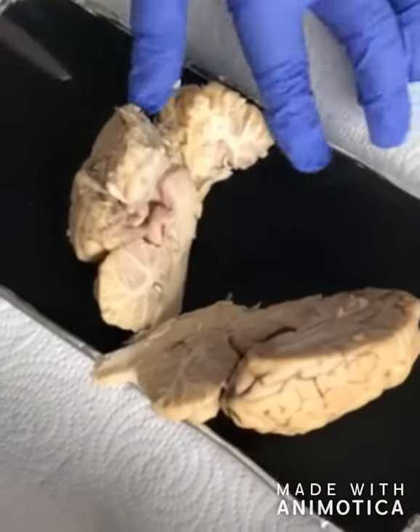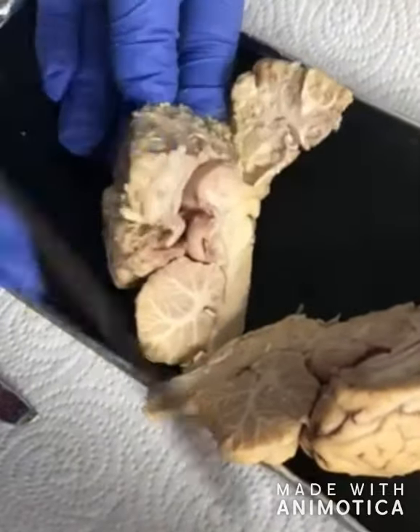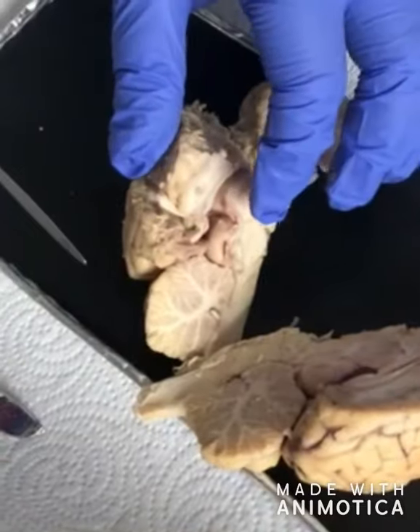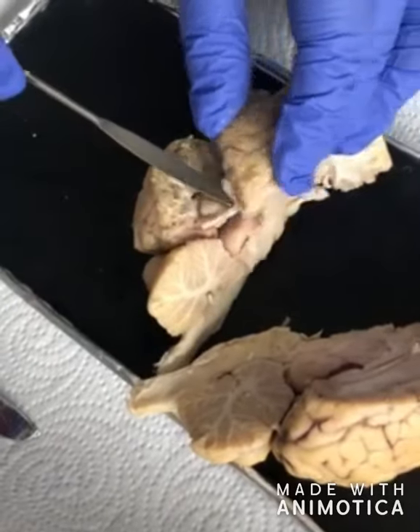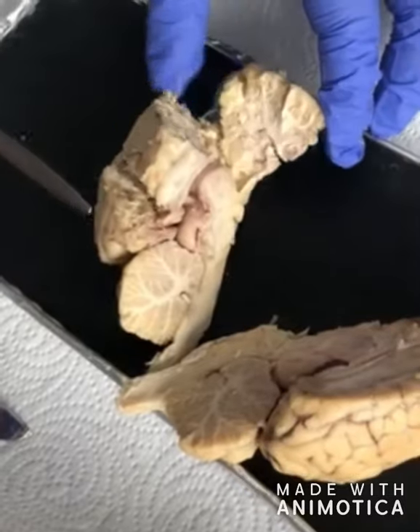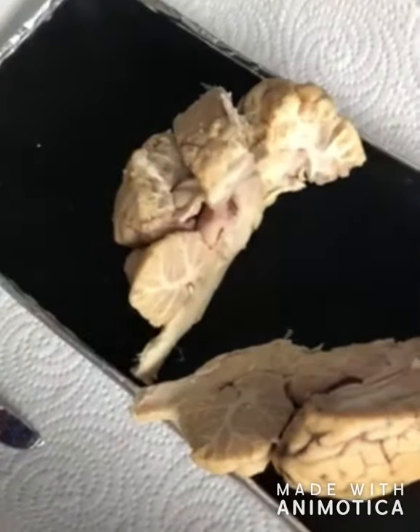Next, we have the basal ganglia. This is part of the brain that is seen to control movement and learning. An example of this function of the basal ganglia is like catching a ball. This is linked to 3 different parts: the caudate nucleus, and this is associated with motor function. The putamen, this plays a role in movement of the limbs, and the globus pallidus, this plays a role in voluntary movement. If this part of the brain becomes damaged, it can actually cause movement disorders. It's a pretty interesting fact.